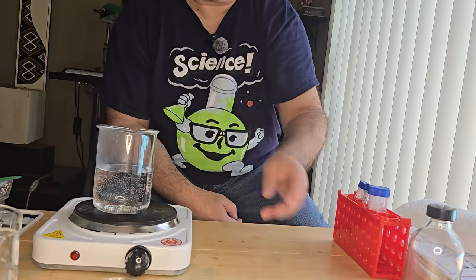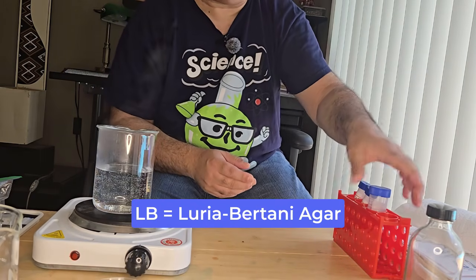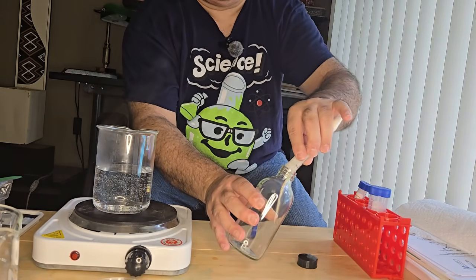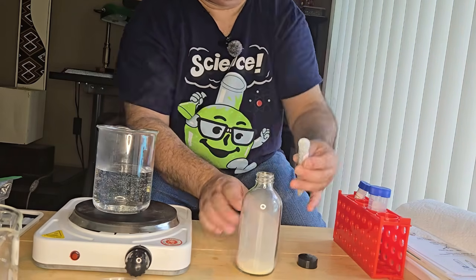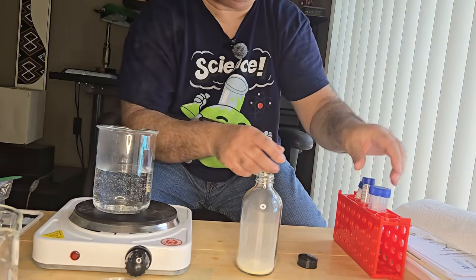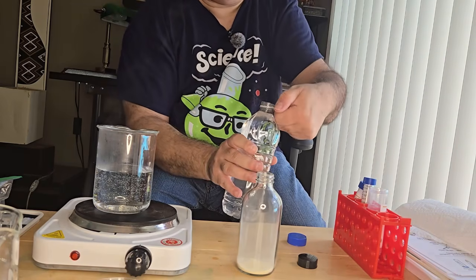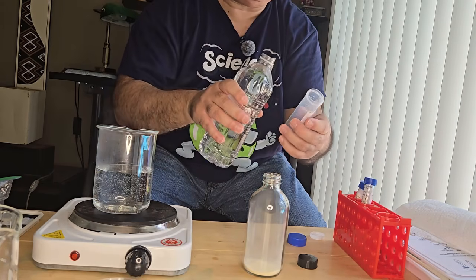The first is just a simple LB agar plate. So I have my agar and I'm going to add it to this glass container. It was pre-measured agar. And then what I want to do is add 150 mLs of water. I've got this measuring tube that I'm going to use. I could use a measuring cylinder, but if you don't have one, you can use one of these plastic measuring devices.